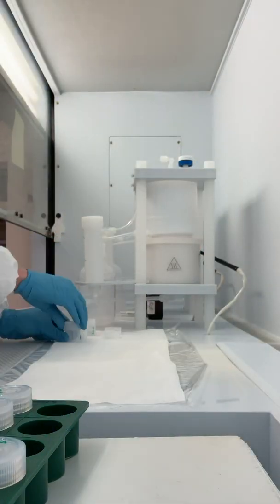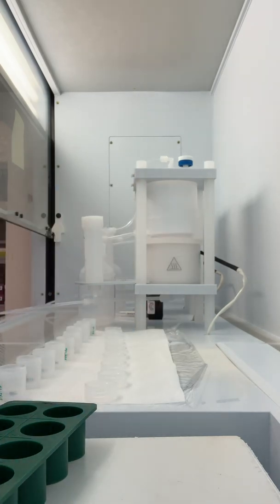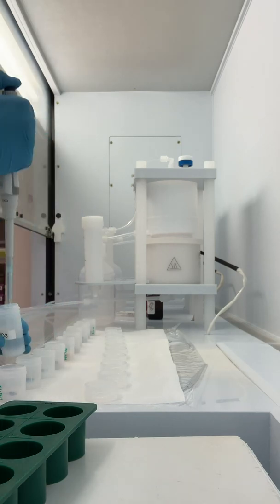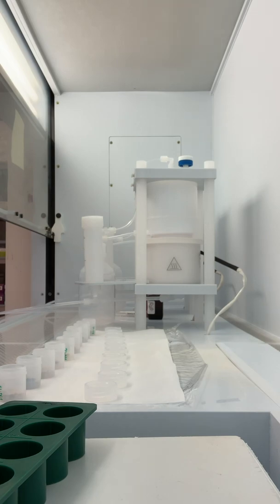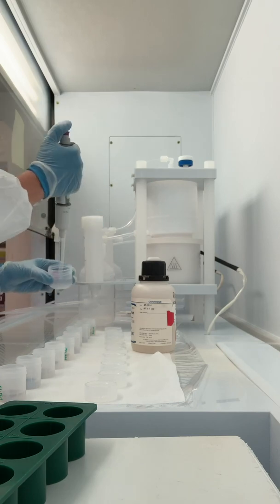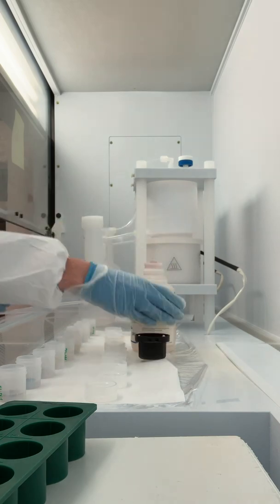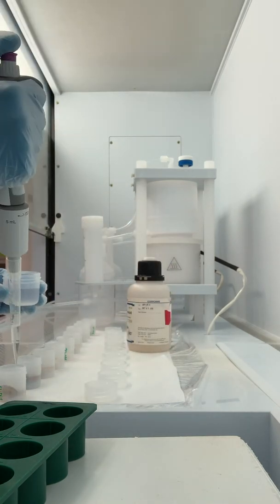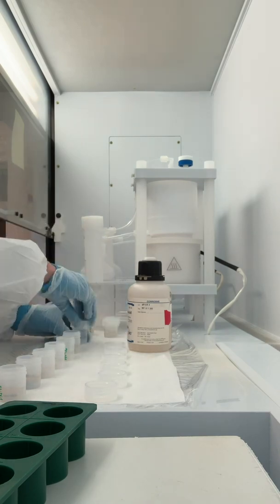Once I'm ready to go into the clean lab, the samples come with me. The next step is to start what we call the dissolution process. This is where we use a mixture of acids to actually break down a solid rock into a solution, which is absolutely crazy. We're able to take something that is very difficult to break even with a hammer and completely dissolve it into something that we can then put through columns, and ultimately measure different element concentrations out of it. This is an incredibly neat experience and something that I personally enjoy, even though I've been doing it for years.